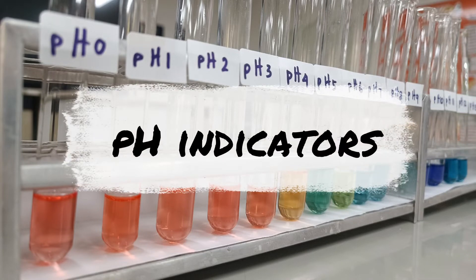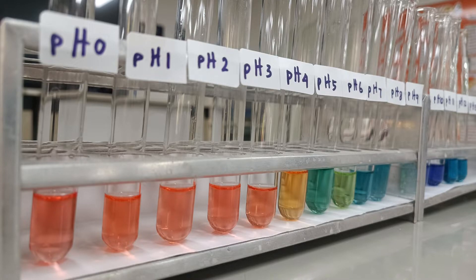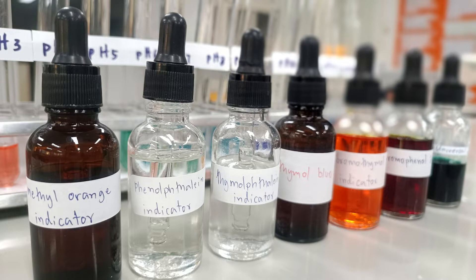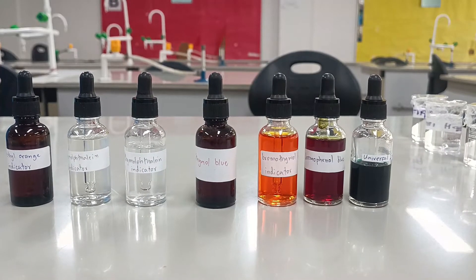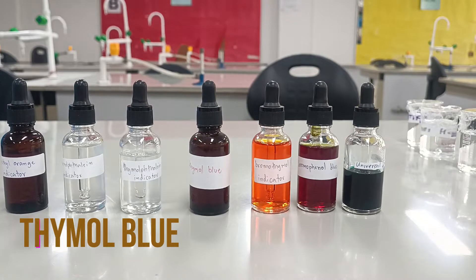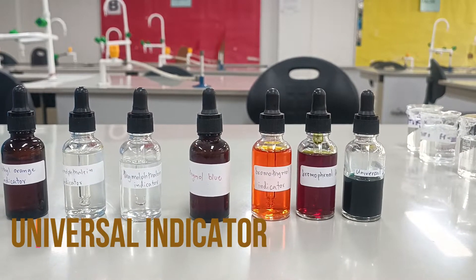Hello everyone. Today I'm going to show you the different colors of different liquid indicators. Indicators are usually used for titrations to show the equivalence point of a reaction. The indicators that we are going to be looking at today are methyl orange, phenolphthalein, thymolphthalein, thymol blue, bromothymol blue, bromophenol blue, and the universal indicator.